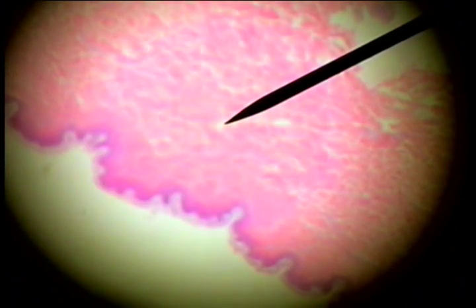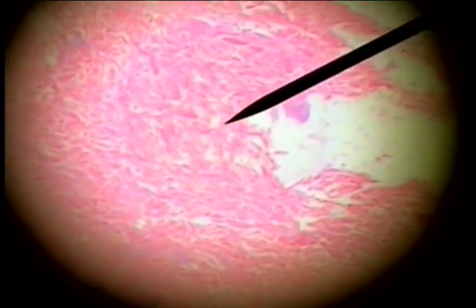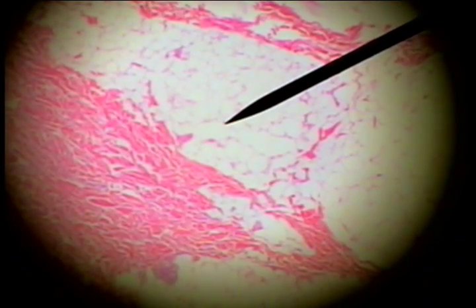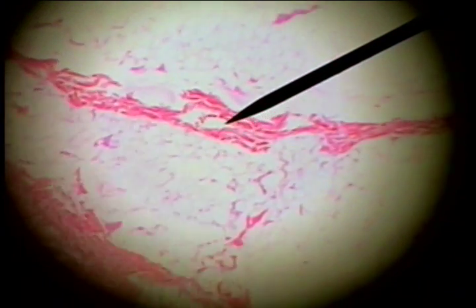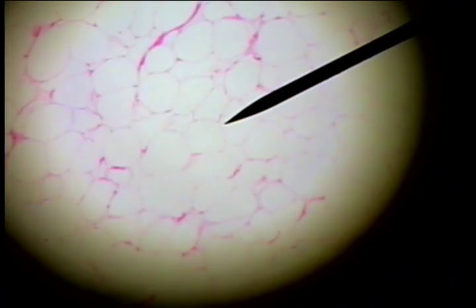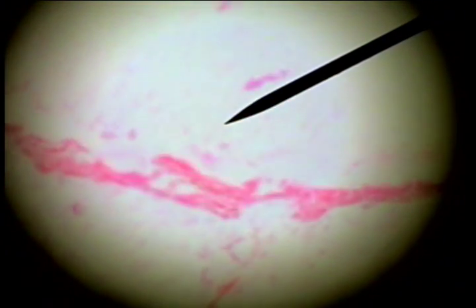The next layer down is the dense irregular connective tissue — we'll go to a lower power — and this is the dermis. The dermis ends here, and the deepest layer is the hypodermis, composed mostly of adipose and connective tissue.